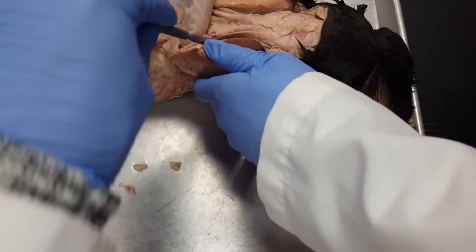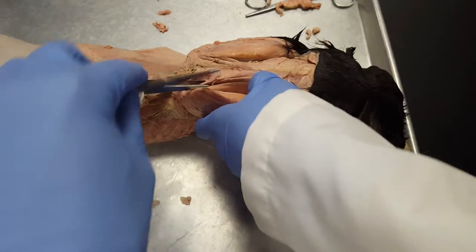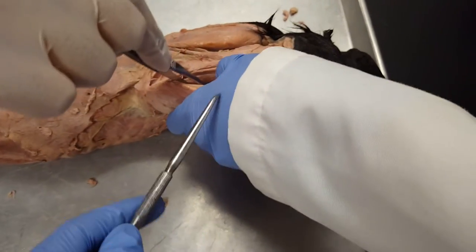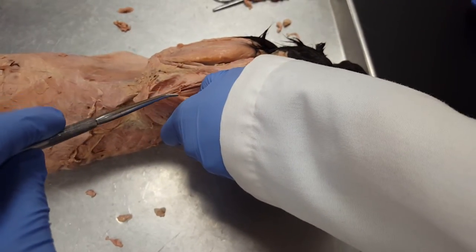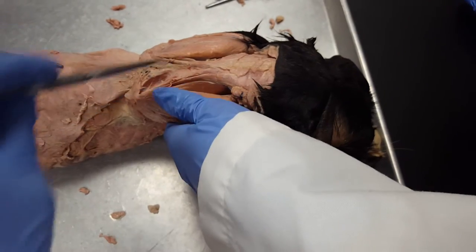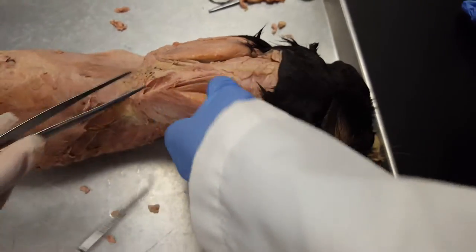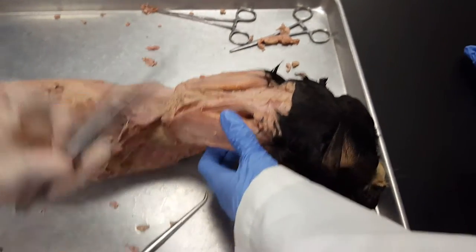This is the rhomboid — rhomboid major and minor, but the rhomboid group. Subscapularis — sub is in here. Supraspinatus is here. And then infraspinatus, you can see on the other side.